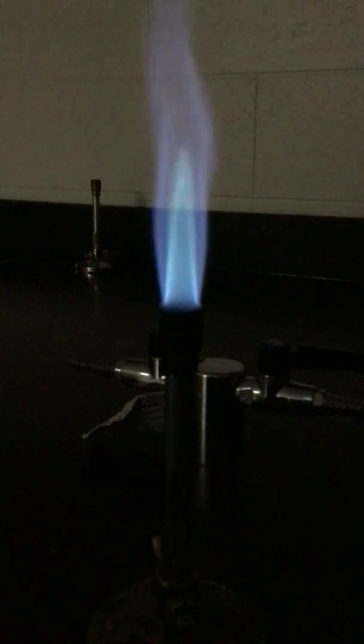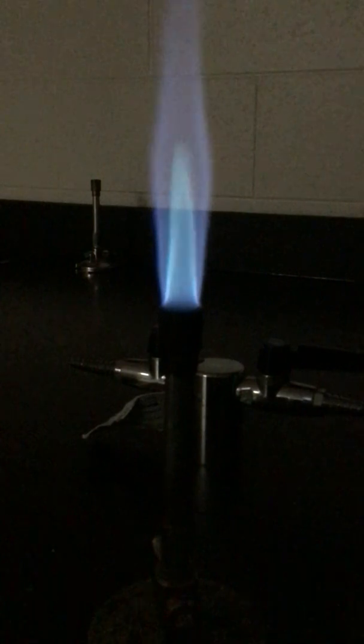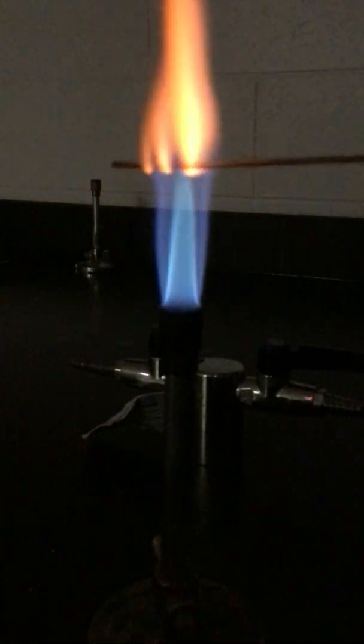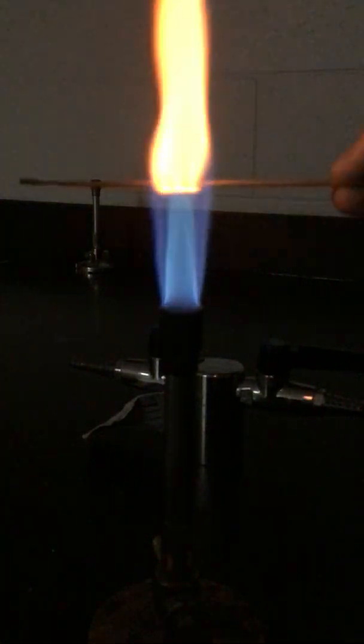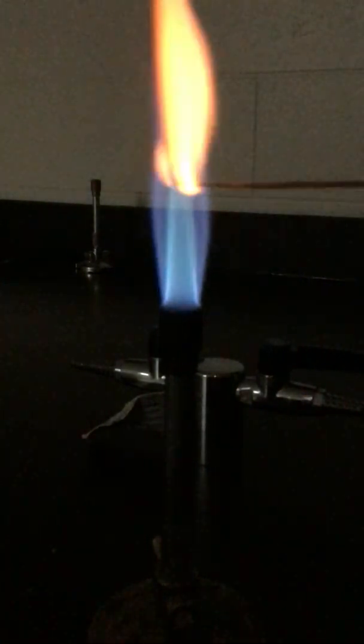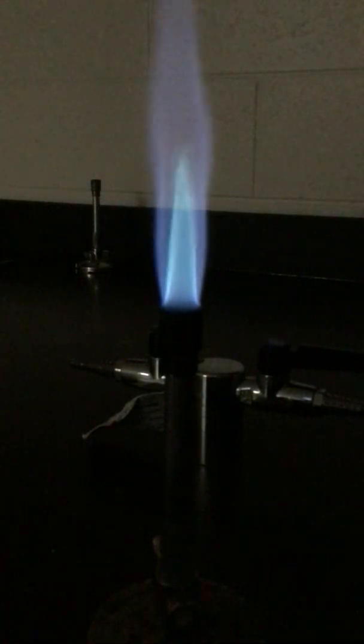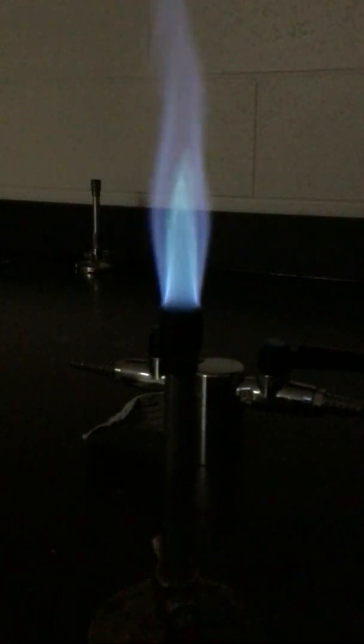So this is going to be your unknown substance. Okay? So here comes the unknown. This is the unknown element. Tell me what you think it is. Okay? If you need to, go back to the video and slide back to each of the different 6 substances and look at the video and see which one it most closely resembles. From that, tell me which element you think that it is.